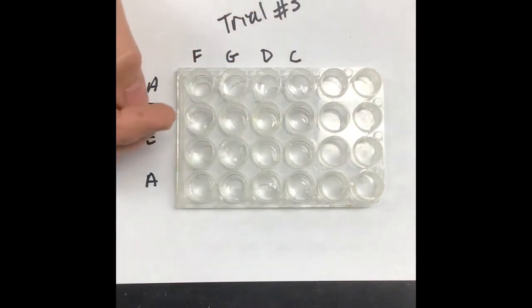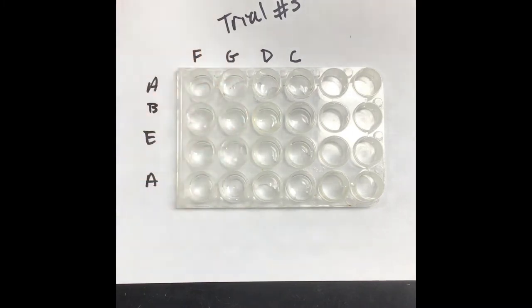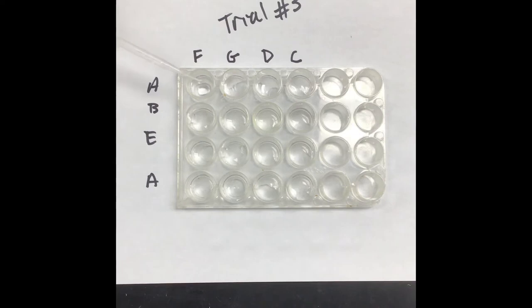I'll then repeat what we did in trial 2 by going down and adding an additional 10 drops down so that we can see if there's a difference in concentration. And so let's go ahead and get started and see what it is. This is all up to you guys. I'm not going to tell you anything about how to do it, but we'll see. Okay, so 1, 2, 3. Okay, 3, 4.